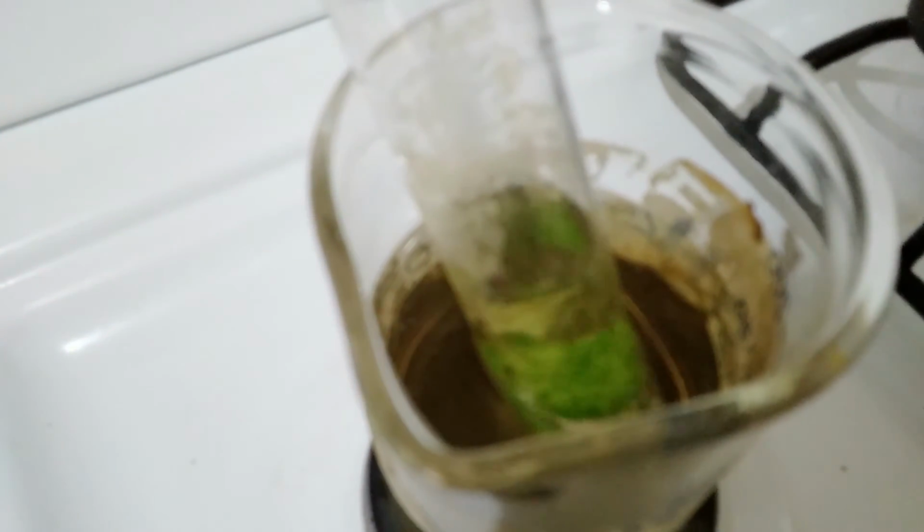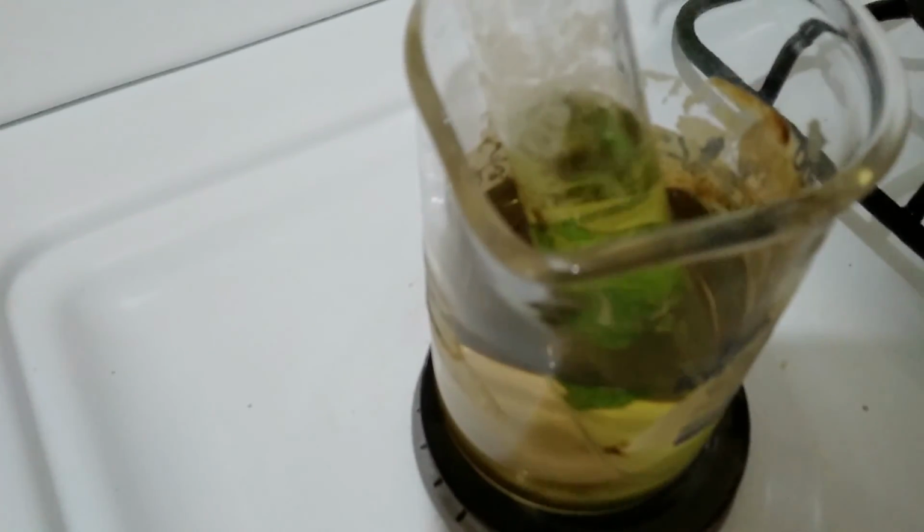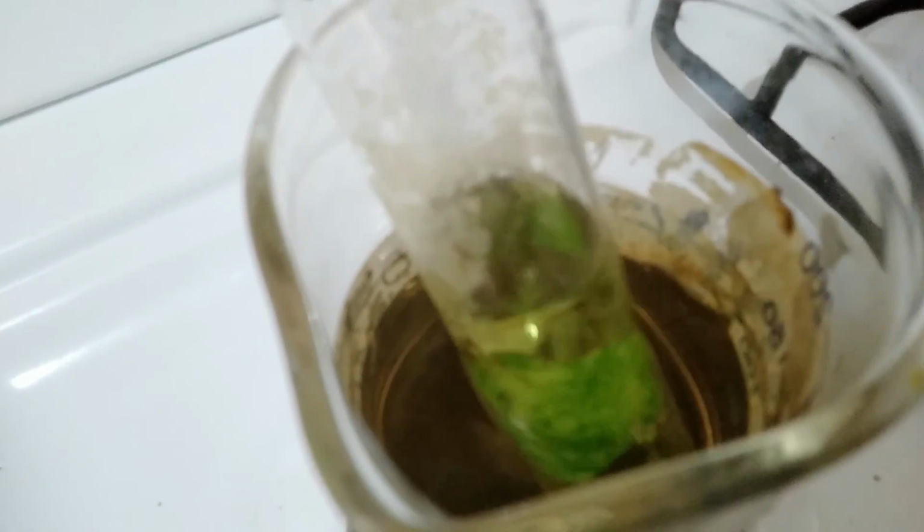It shows signs that it is boiling. Now, yes, it is boiling. There it is. And why is this so? Water boils at 100 degrees Celsius. However, alcohol would boil at 78 degrees Celsius. So if alcohol boils at a lower temperature, and you were to expose the alcohol to an open flame, tell me what you think would happen. All right, so that's a part of your discussion. Why wouldn't you put this alcohol over an open flame?